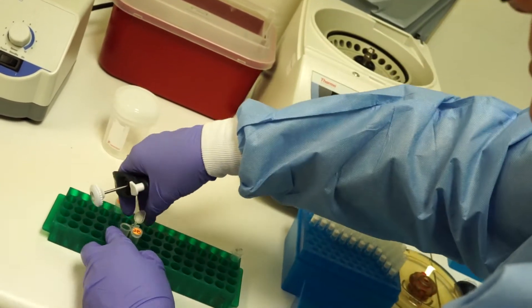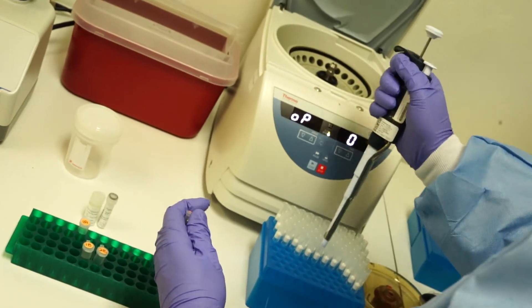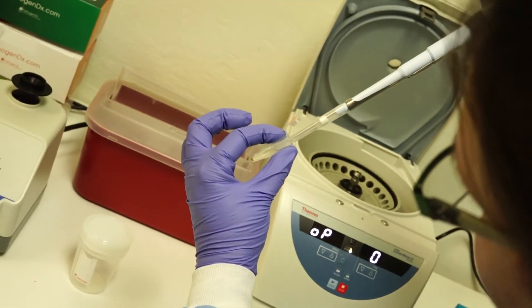Do this for all samples, making sure to change the tips to prevent any contamination between samples.